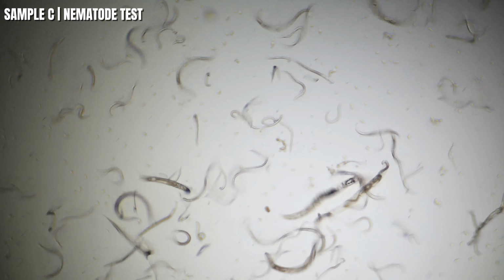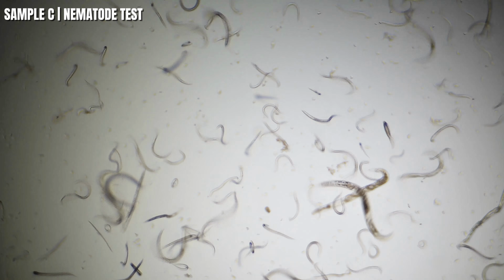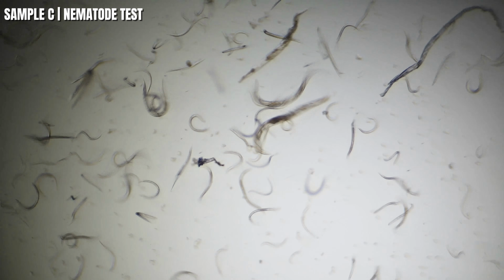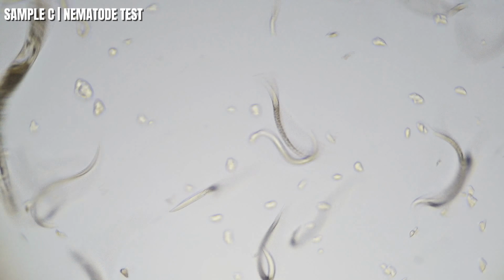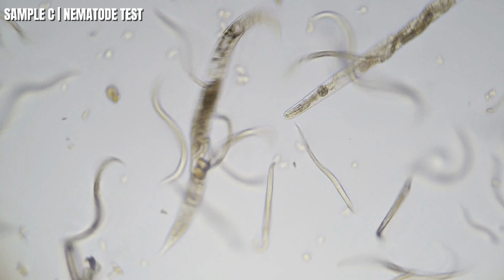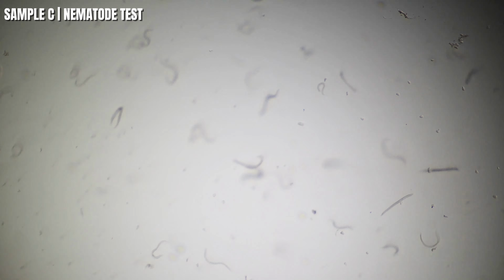All right, here's sample C nematode and busy slide here, you guys. So sample A, okay, sample B. So look at the difference. And what's crazy was sample A kind of woke up again after a while and sample B didn't. So here's sample C. Let's take a look and watch the part of your screen. I'm gonna introduce sample C's whiskey. And there it is. Let's see how they do.